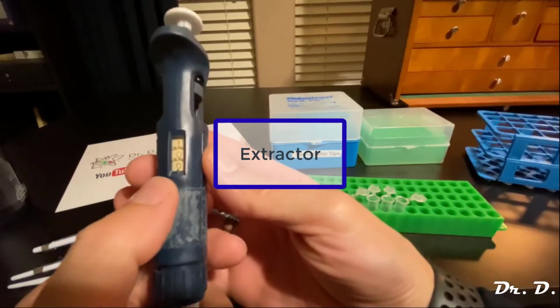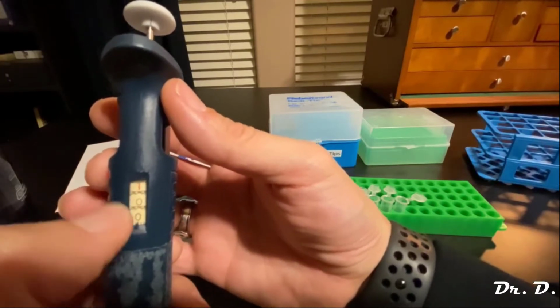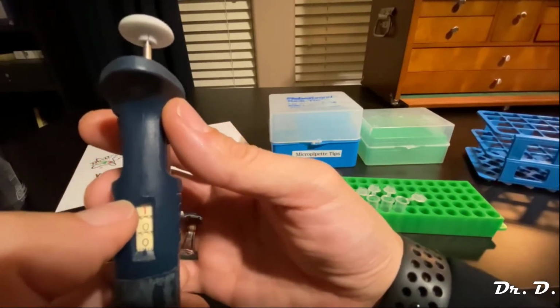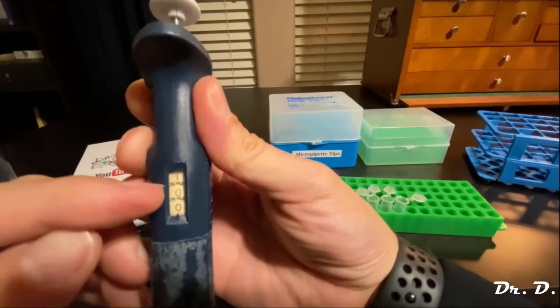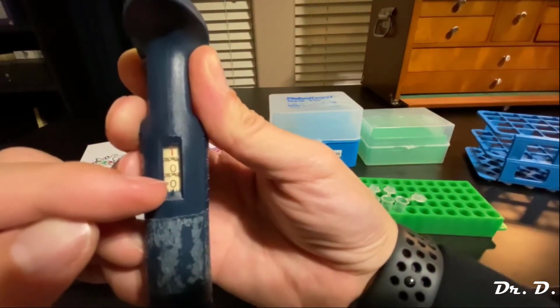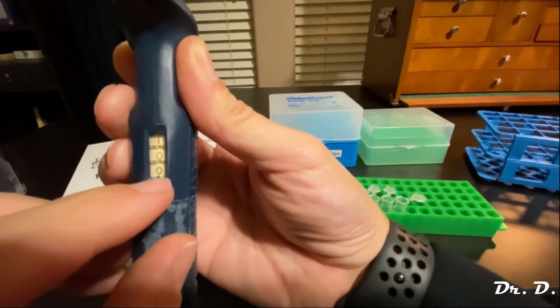And over here, notice that there are 3 numbers, right? 1, 2, and 3. It kind of looks like the odometer on your car, right? So the top number is the thousands number. The second number, the middle number here, is the hundreds. And then the third number is the tens. And the ones are actually the notches on the bottom of the bottom number down there.